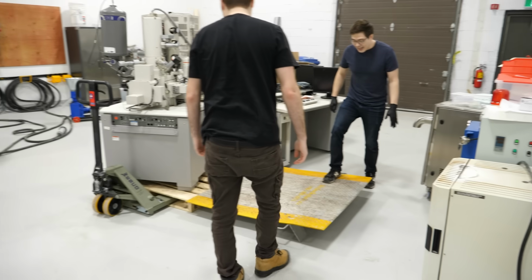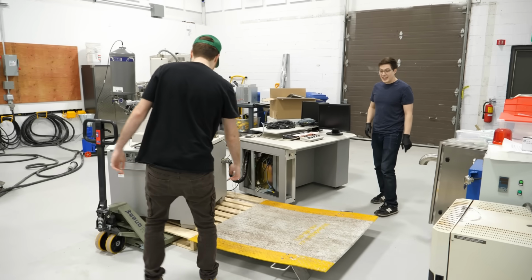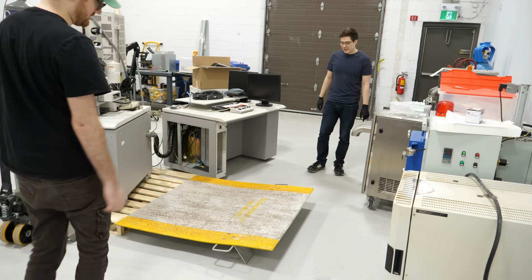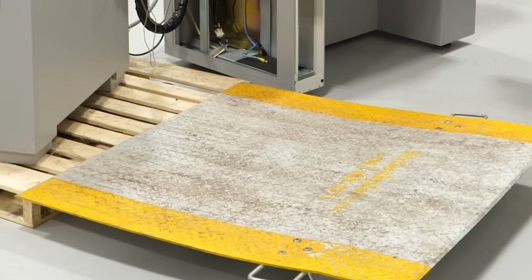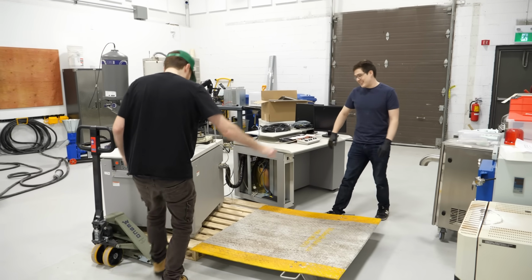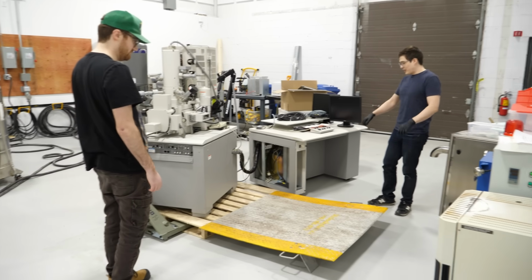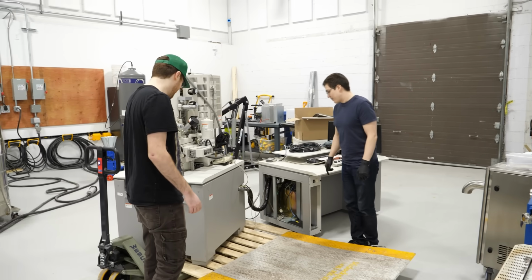See? I don't 100% know if this... Because if we can get it on here... Yeah, but I don't trust that this is gonna hold. But if we throw some wood under there, like 2x4s, you could get it onto here. Remove this. That's easier said than done, but you could put wood there, and slowly shim it down. Medieval elevator.